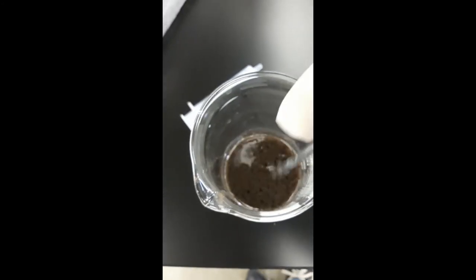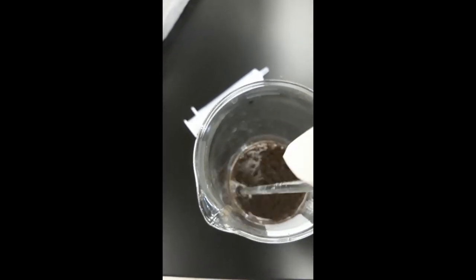And this sludge, by the way, is from the fish, their waste, the goldfish that we have in the aquaculture system.